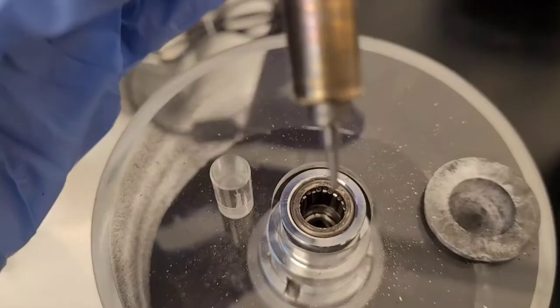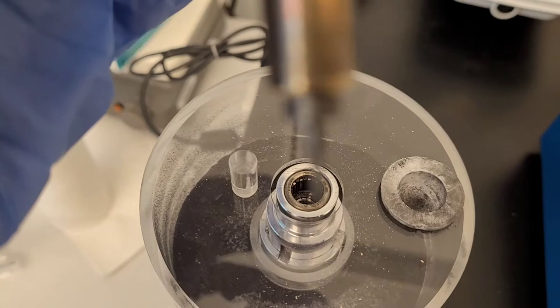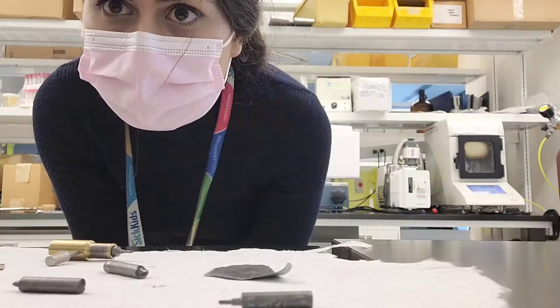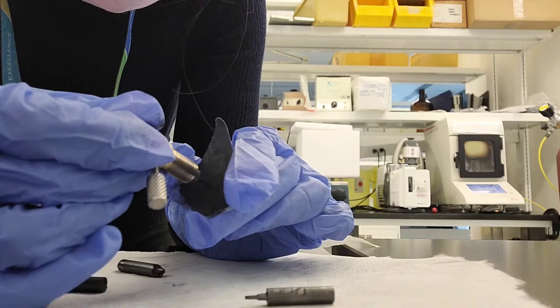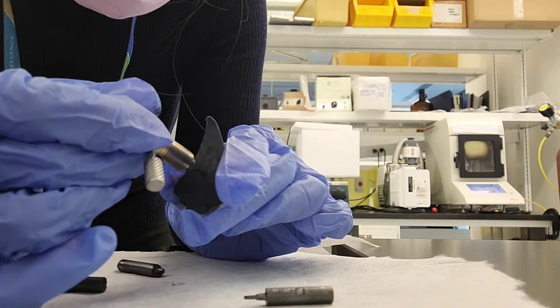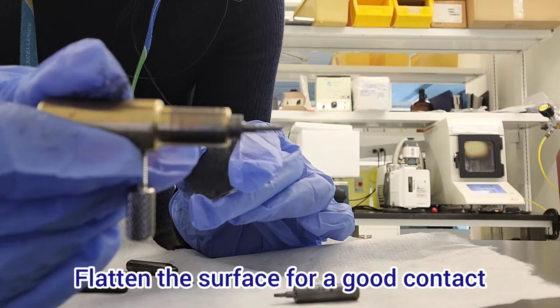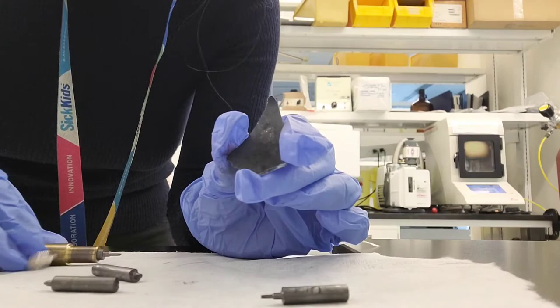You're holding it in place with this pin. It's all sharpened up, and now I have to sand the surface. You sand the surface for the thin rod part and also the other graphite that has the thicker side. Make sure everything's flat because you want to create a good contact between the two pieces.